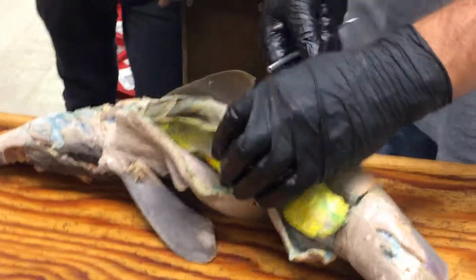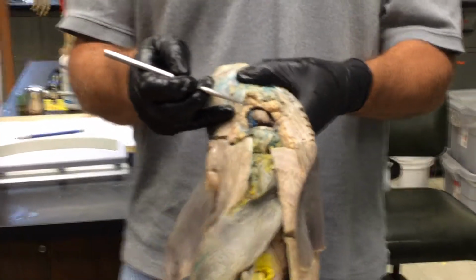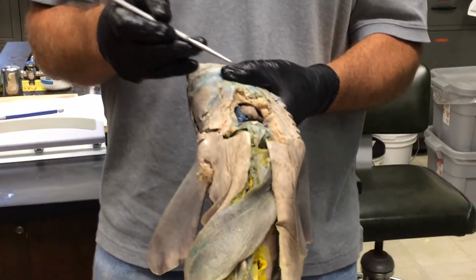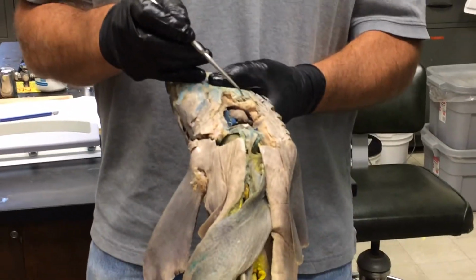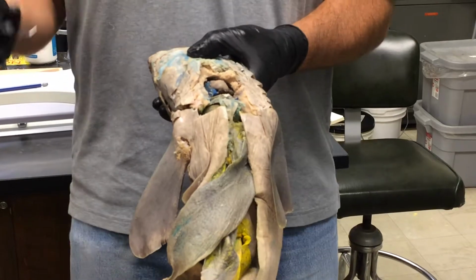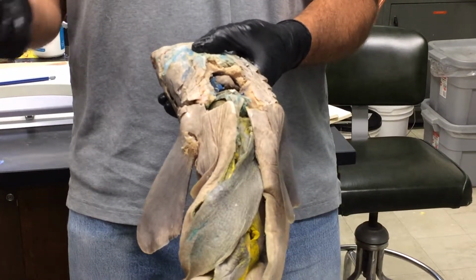We were supposed to open up the pericardial cavity. So there it is, pericardial cavity with the heart sitting in it. And heart. Okay, got that. Just like there's the serosa lining the pleuroperitoneal cavity, we have a serous membrane here as well.